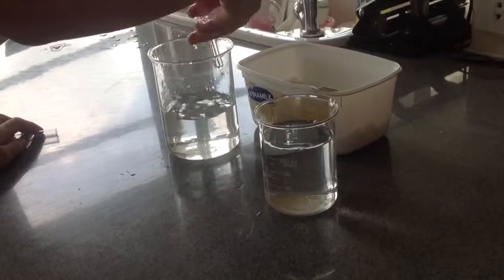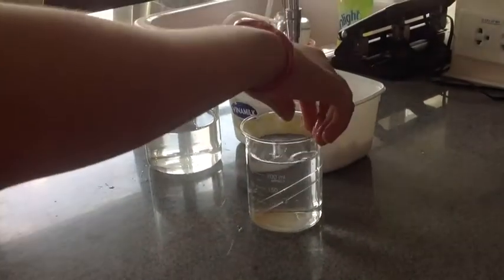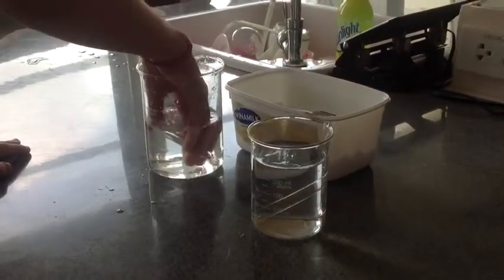You'll also have to fill small test tubes with salt water and then try to put them upside down inside the small beaker, making sure no air can escape.